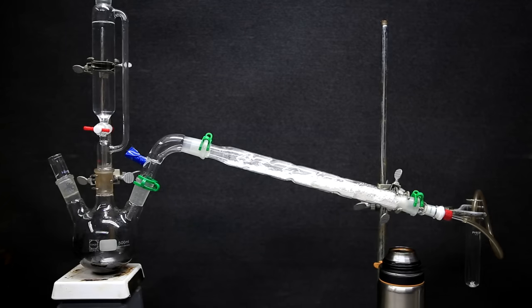The oxygen is pushed out of the neck on the right and down a tube containing drying agent. In my case I used calcium chloride and it's important to dry the oxygen because it will be carrying quite a bit of water with it.